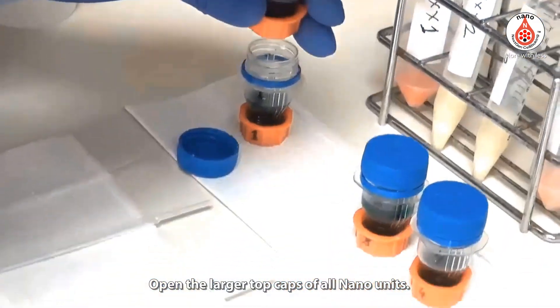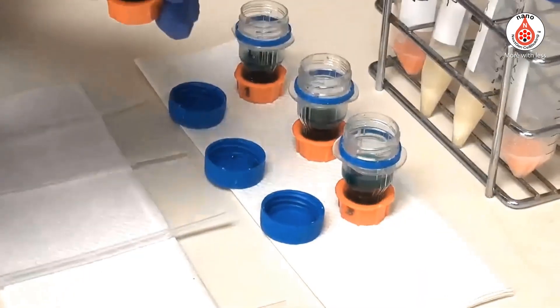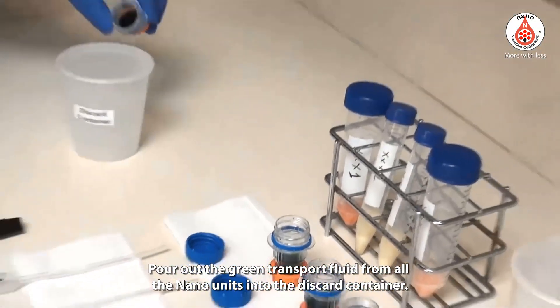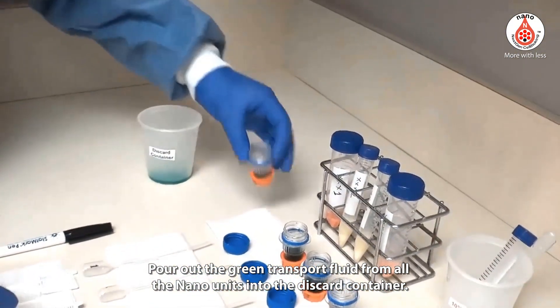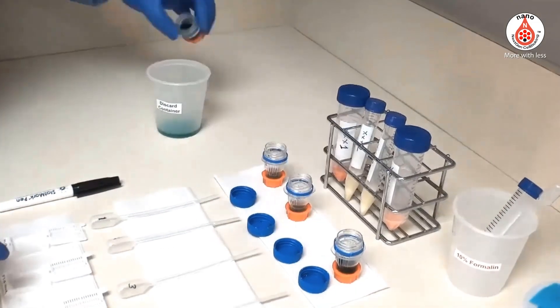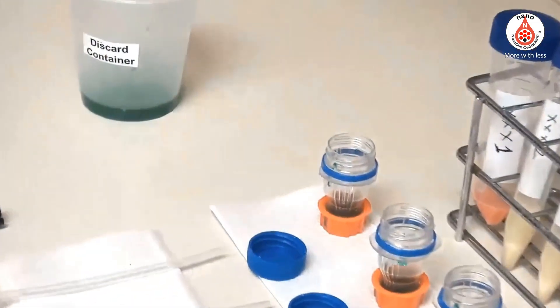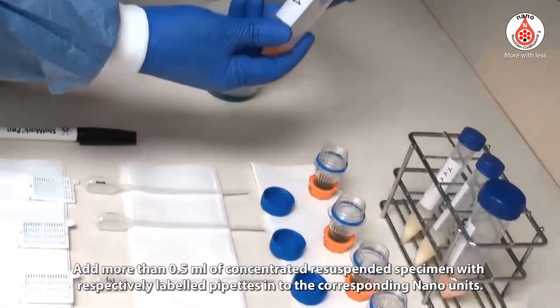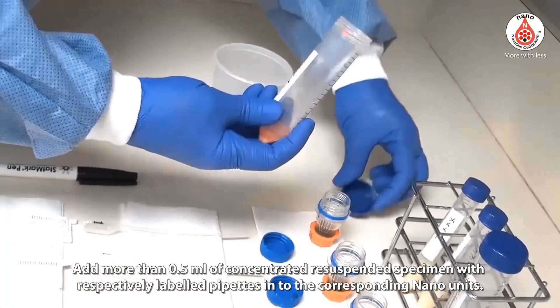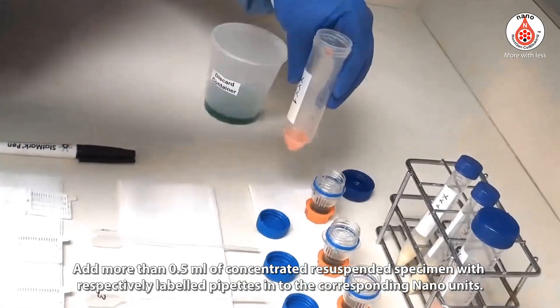Open the larger top caps of all nano units. Pour out the green transport fluid from all the nano units into the discard container. Add more than 0.5 ml of concentrated resuspended specimen with respectively labeled pipettes into the corresponding nano units.